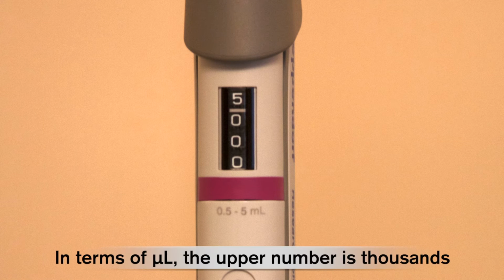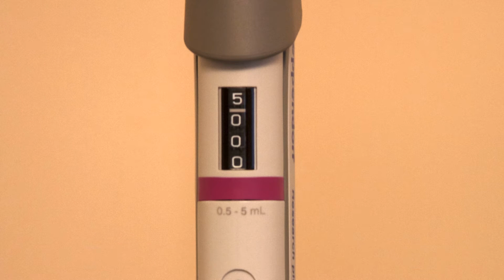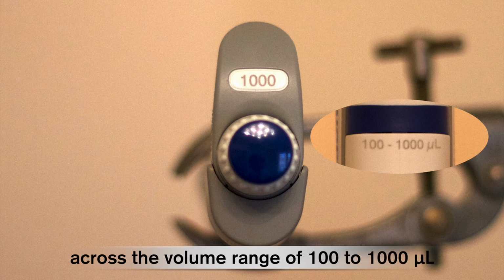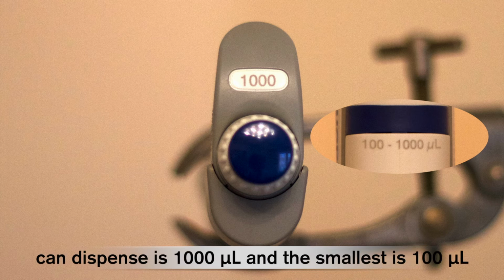In terms of microlitres, the upper number is thousands, followed by hundreds, then tens, and finally units. This tells us that the pipette is accurate across the volume range of 100 to 1000 microlitres. Therefore, the largest volume this pipette can dispense is 1000 microlitres and the smallest is 100 microlitres.